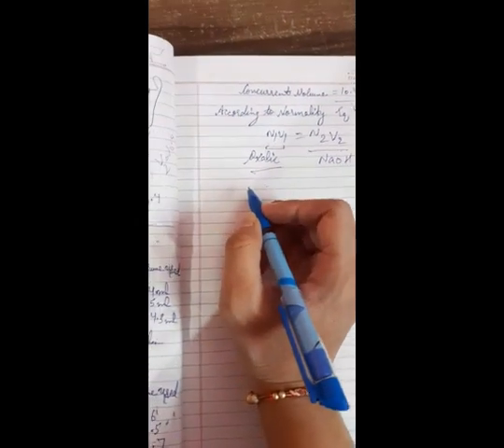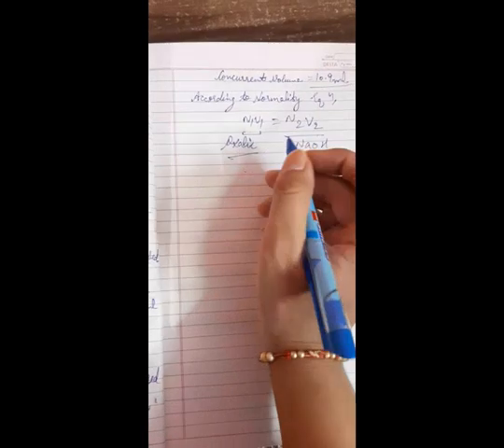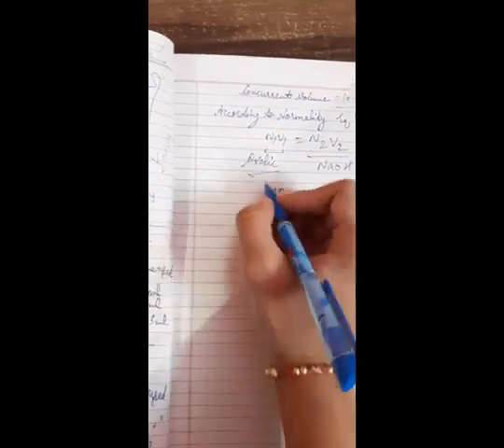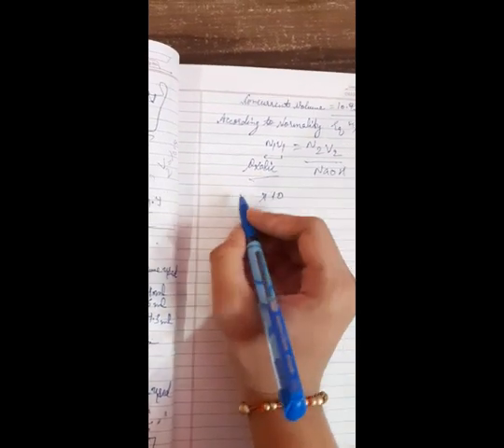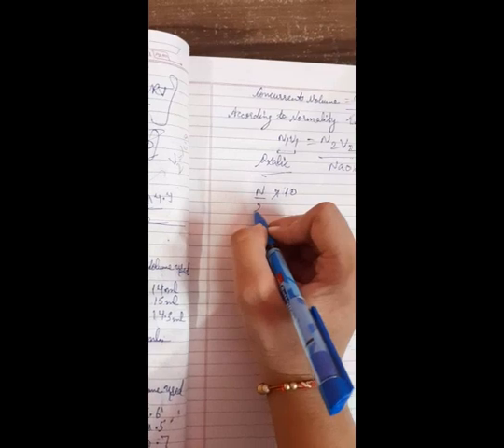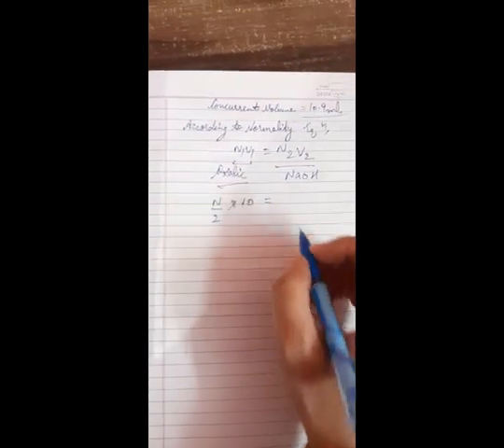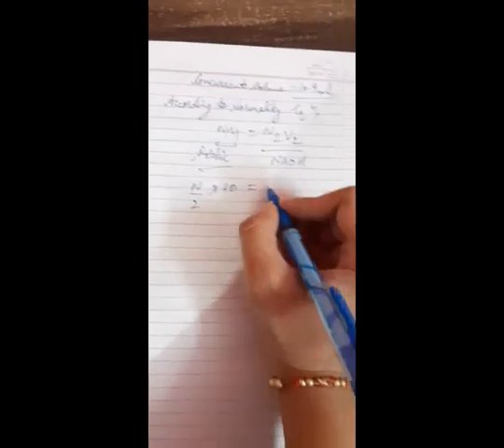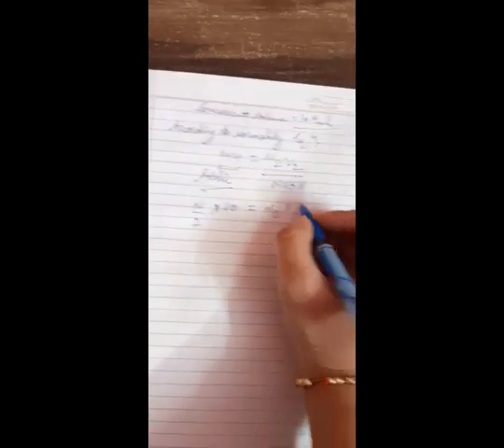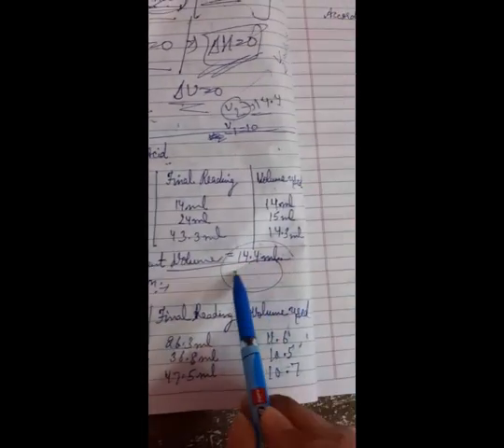Now in the experiment, as we have taken the oxalic acid solution in 10 ml, so here V1 is equal to 10, and the normality of oxalic acid solution is N by 2. So N1 is equal to N by 2, which equals N2 into the volume of NaOH, which is found to be 14.4 from the concurrent volume observation.